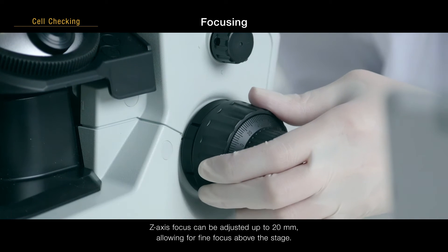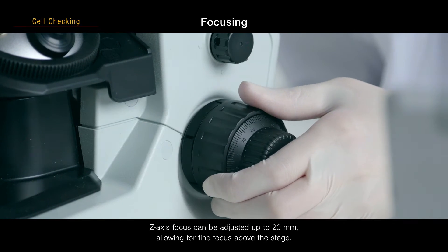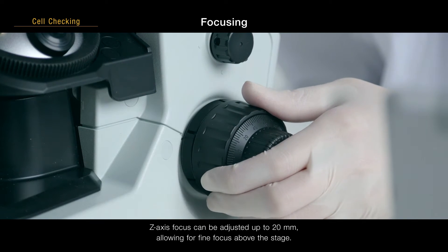Z-axis focus can be adjusted up to 20 mm, allowing for fine focus above the stage.